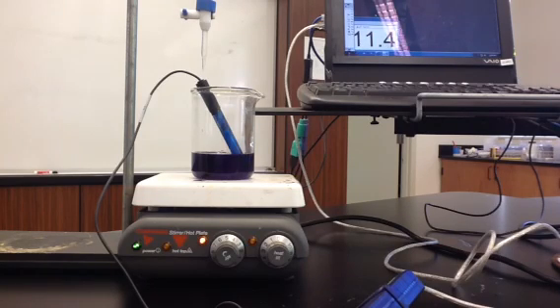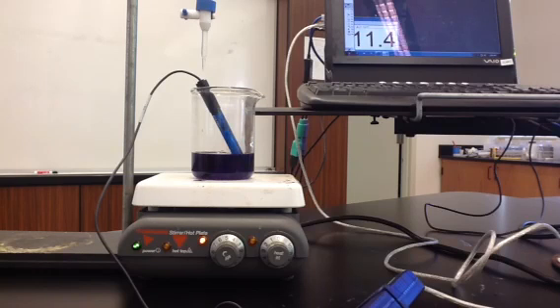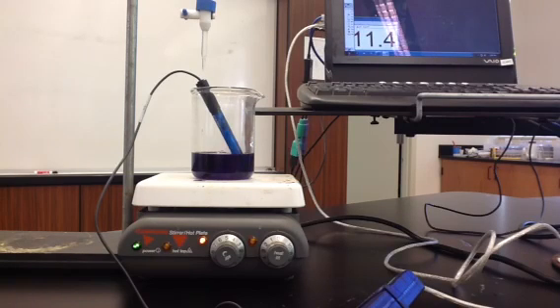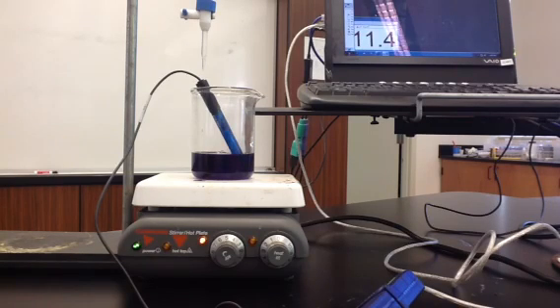So you have the data you need. You know how much of the base was added. You recorded the pH and the color of the solution.